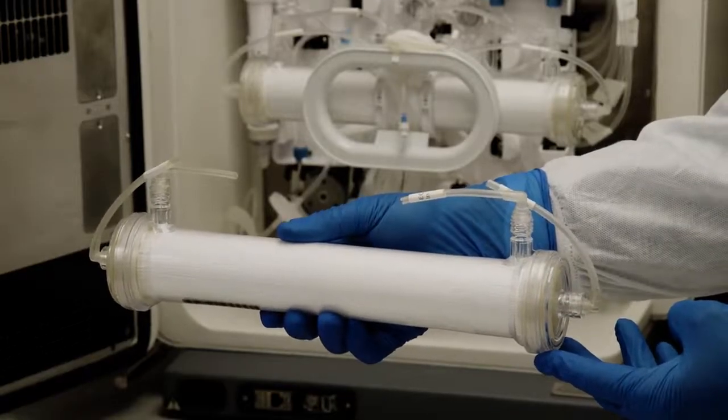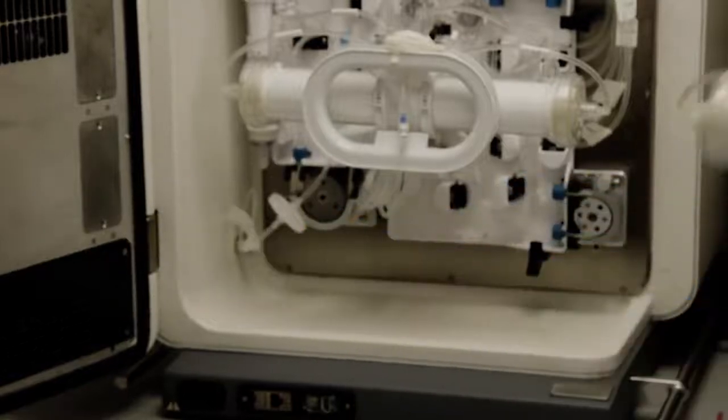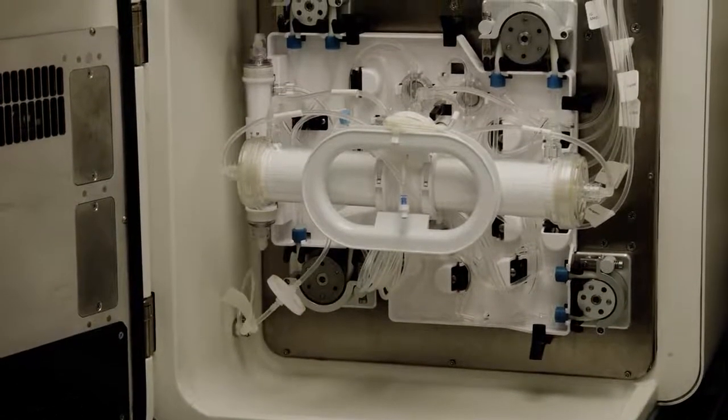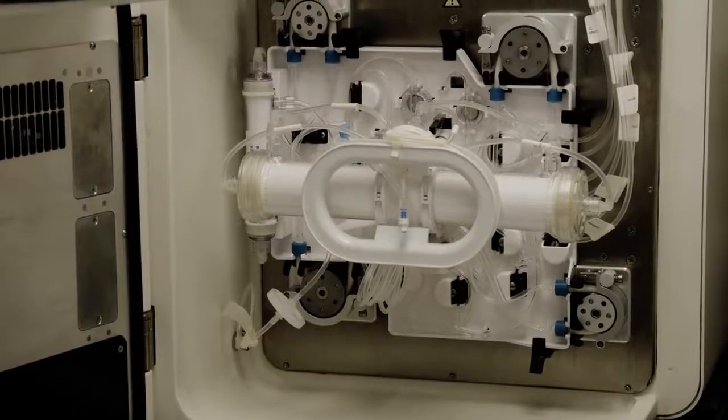The dual loop also allows for a maximum harvest efficiency, allowing for small harvest volumes of 430 to 700 mils. This will ease your downstream processing needs.